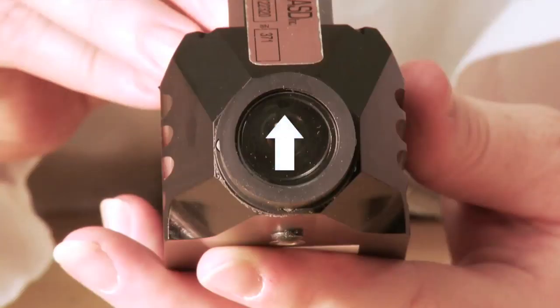Once the cable is secure, check the window once again to make sure that the cable is fully inserted.